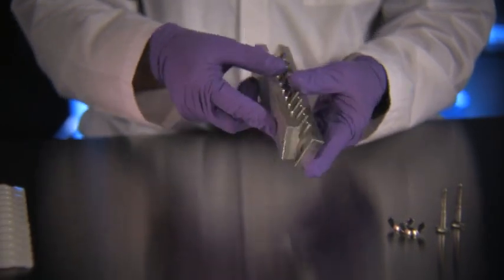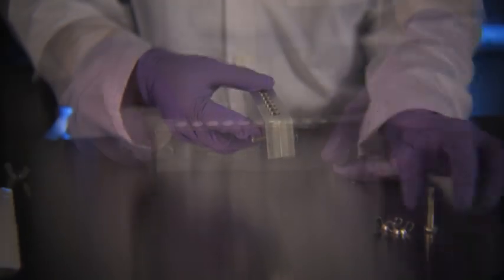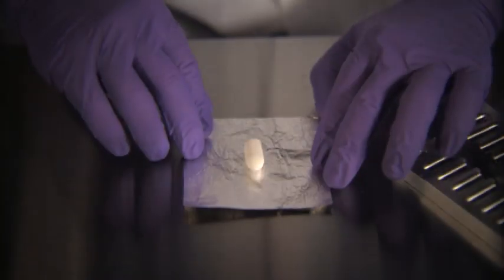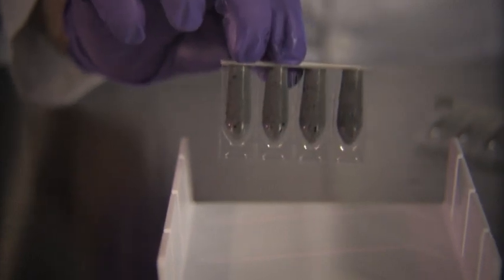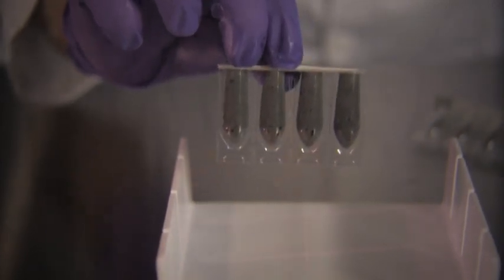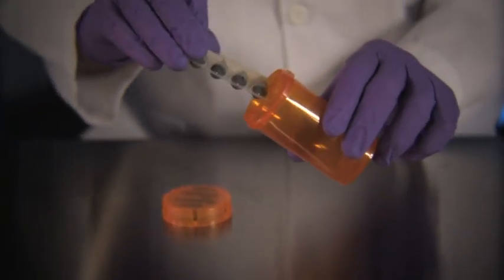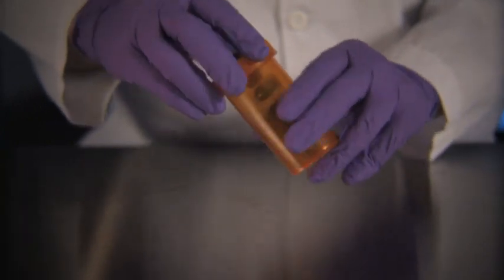Aluminum molds consist of two halves held together with screws until the material is added. After the material hardens, the two halves are separated and the suppositories are wrapped in foil for later use. Like plastic molds, rubber suppository molds come in strips that can be cut into shells. The strip is dispensed to the patient in a prescription bottle, and when it is time to administer, the patient pushes the suppository out of the mold.